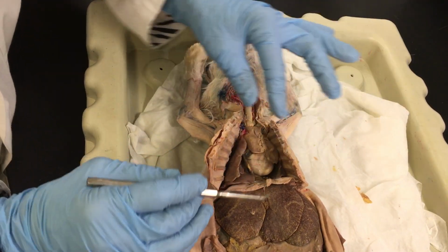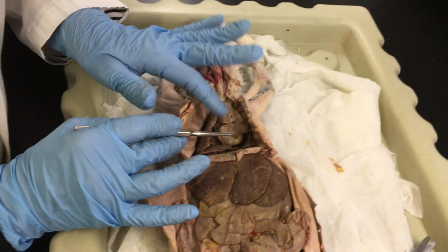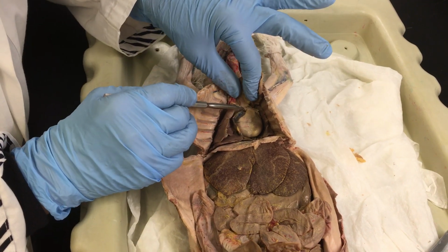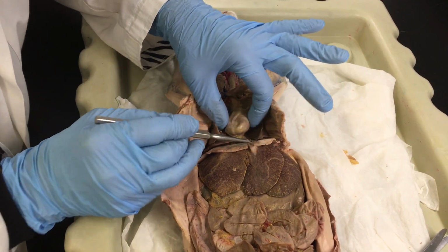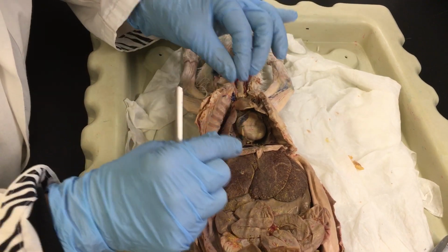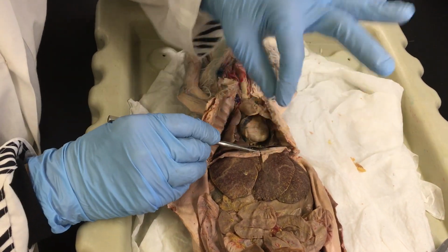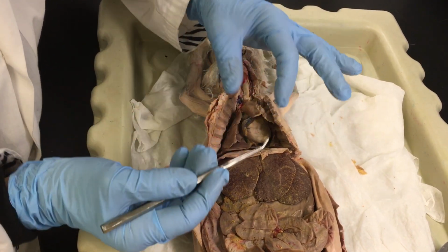Meanwhile, let's continue. There is a term called the mediastinum. The mediastinum is this area here, in the middle of the chest, where the heart attaches on the top part, but on the bottom part it also attaches to the top of the diaphragm. So do you understand that the heart, even when it beats, doesn't go out of place, it just stays all connected. And so it would be here. That is the mediastinum, an area more than a structure.